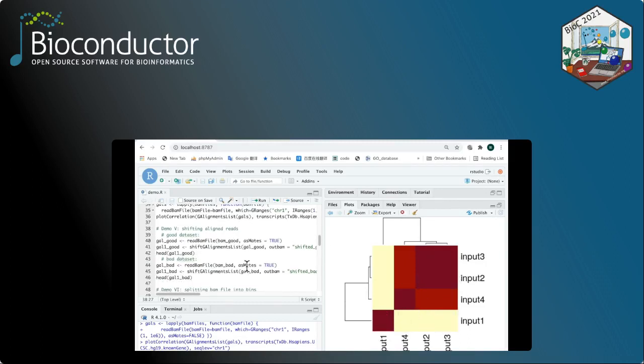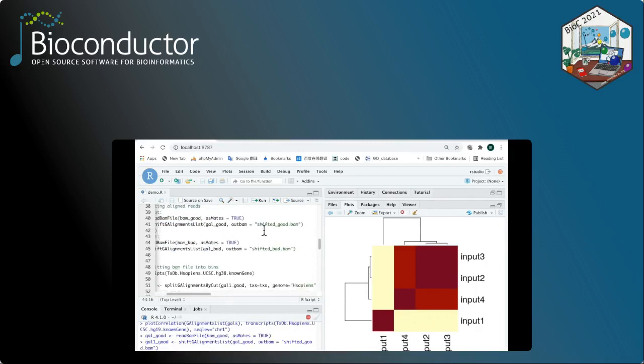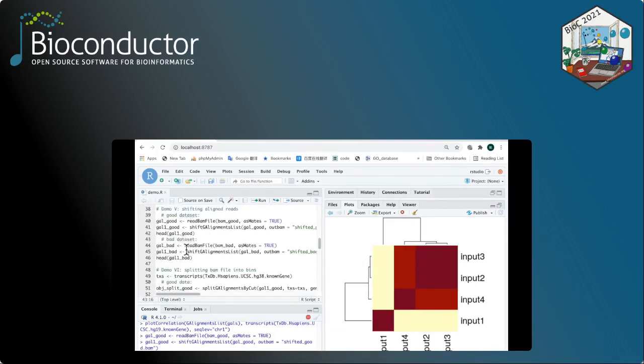For demonstration 5, we're going to shift the alignment using the function called shift GAlignments list. The resulting BAM file will be saved to shifted_good.bam or shifted_bad.bam as specified by the outBAM parameter. This function may take a little bit longer to run, so you have to be patient.